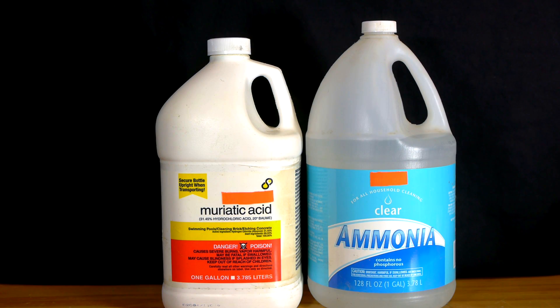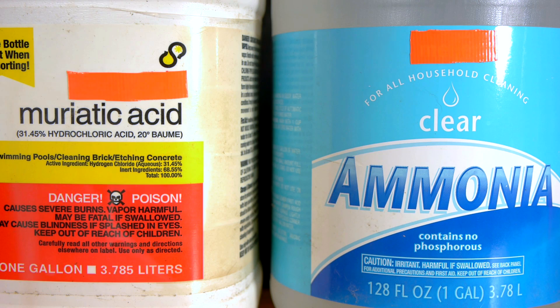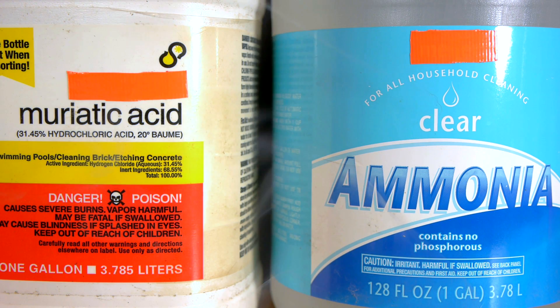The two chemicals used are hydrochloric acid and regular household ammonia. The one you may not recognize, hydrochloric acid, is commonly sold under the name muriatic acid at many hardware stores for a number of different cleaning purposes.